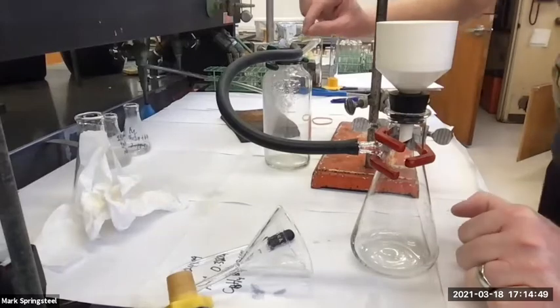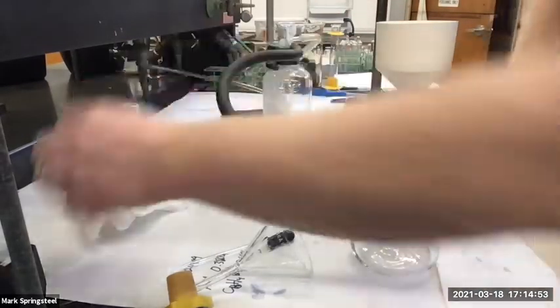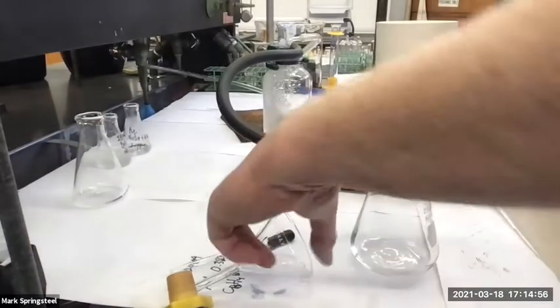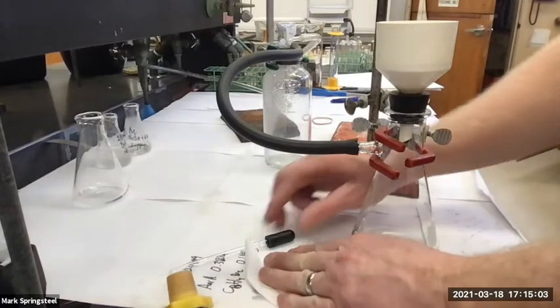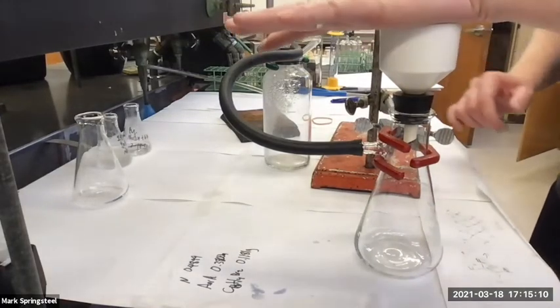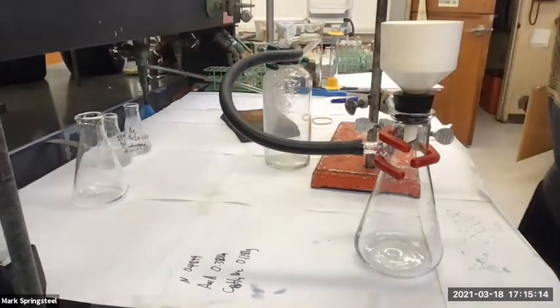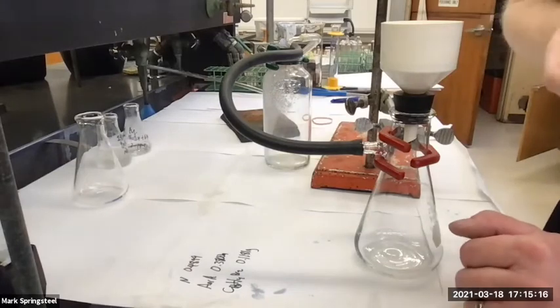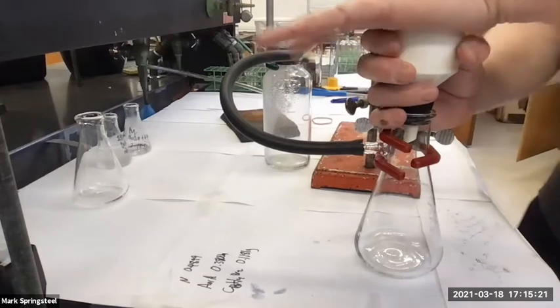I checked each component, the water trap bottle, the hose, all the way through when I did the vacuum filtration during the crystallization lab last time. And if you haven't watched the video, you'll see that. So since I've already checked it once recently, I don't have to be as careful at first to check for vacuum. I'm just going to set it all up like I did and check the vacuum at the end. So I'm going to turn the water aspirator on. It's going to be kind of noisy, so you won't hear me. I'm going to turn the water aspirator on full blast to get good suction. And I'll put my palm over this and see if I can feel it suck. So let's check.